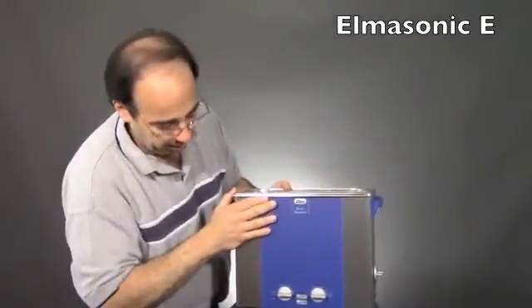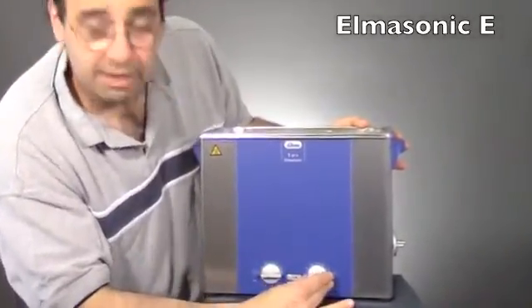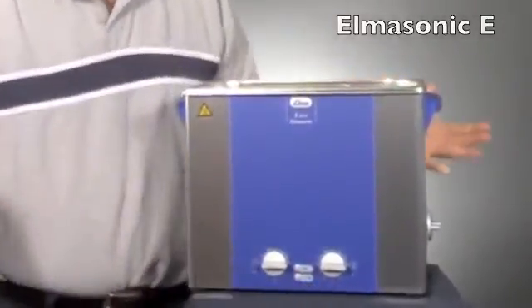To operate the unit, all you need to do is set the minutes on the right-hand dial, the temperature on the left-hand dial, push the on button, and you're all ready to go.